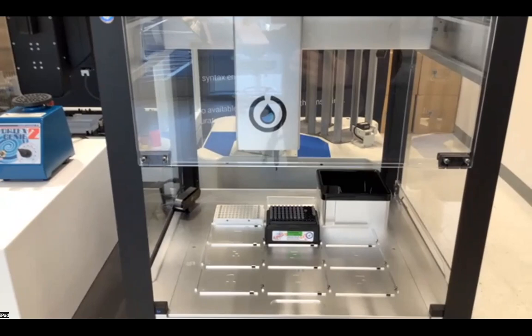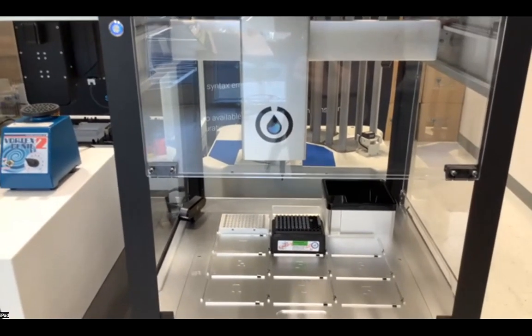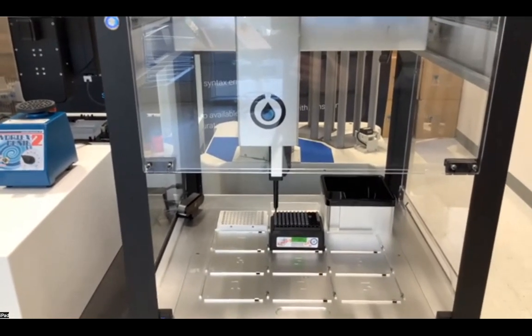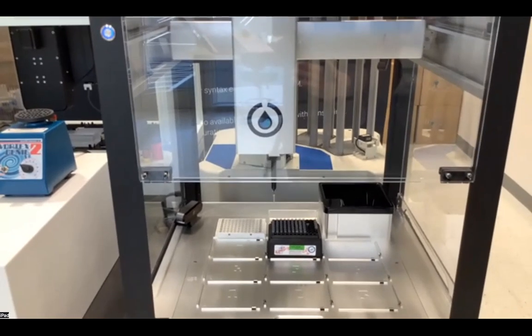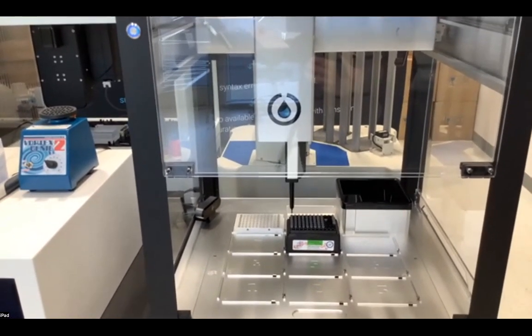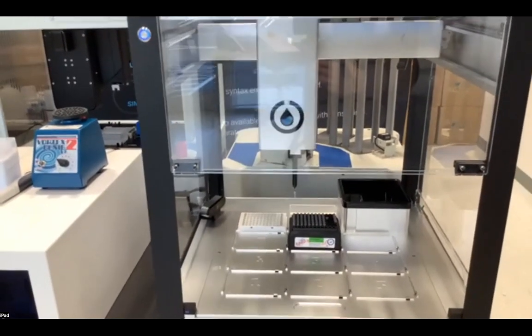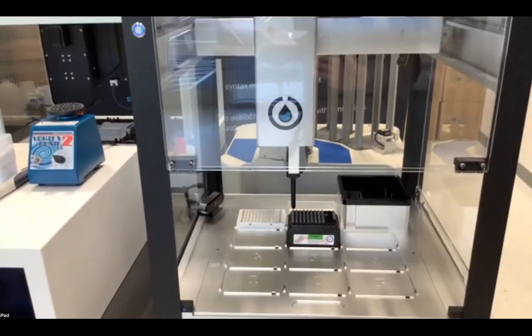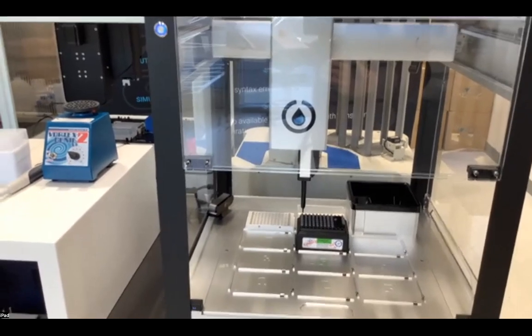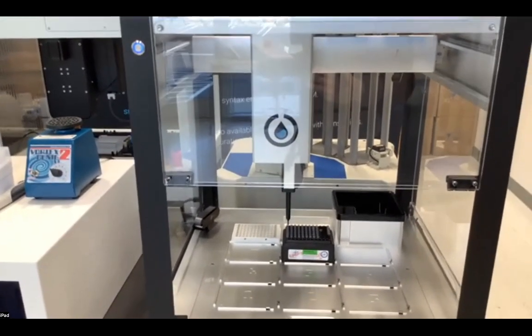The OpenTrons will then begin to pipette. I will probably not show you the entirety of these pipetting motions once you have understood what the power is of Genie LabOS to control all of these features. There it goes. It is also using our current plate definitions for everything. So any plate that we've onboarded into the software, you would have the ability to reference automatically with these other pieces of automation.